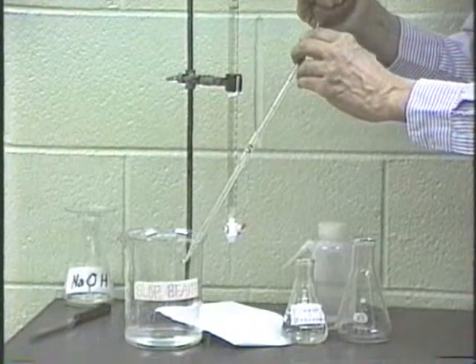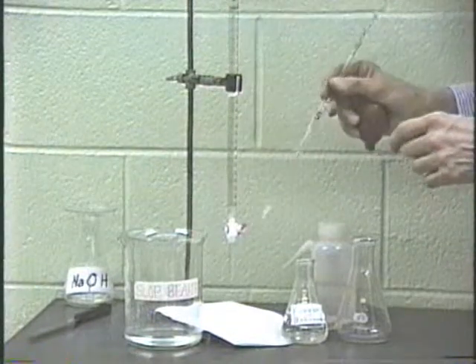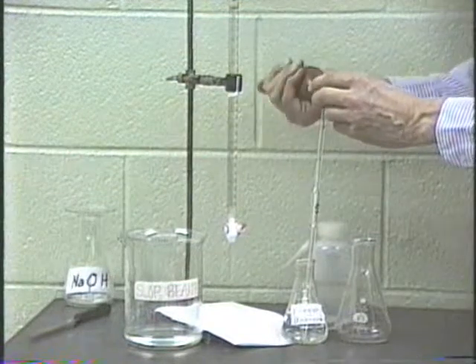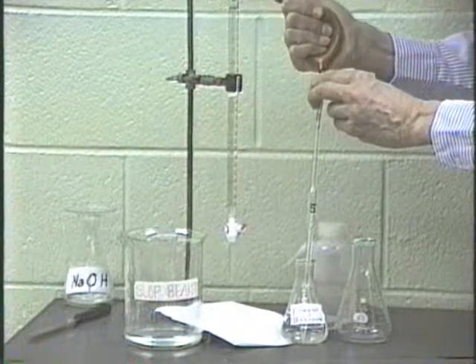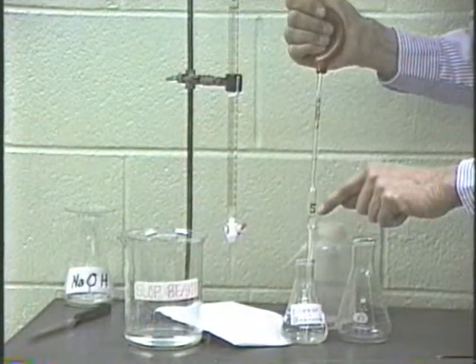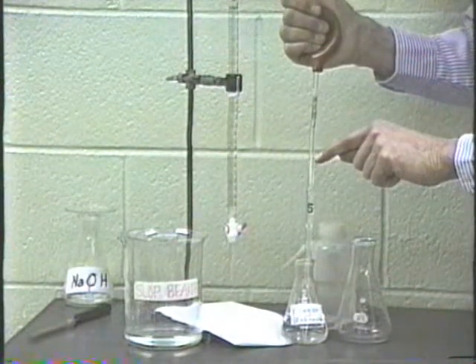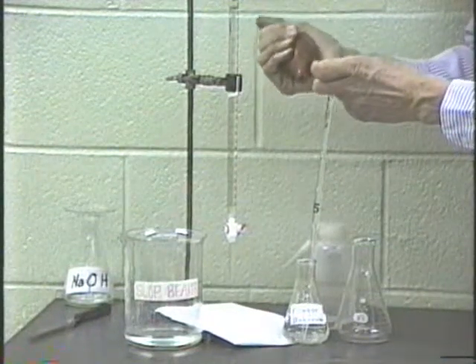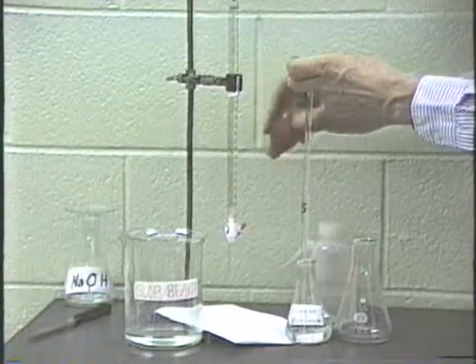We can use the rubber bulb to blow out at this point because we're not interested in exact volumes, we're just rinsing. Once it is rinsed out, then again, we will fill up the pipette. Now, to fill up the pipette, squeeze the bulb, just slip it on, and draw up the liquid. Here's the liquid level coming up here. This is the 5 milliliter mark, and now it's past that mark, bring it, but do not let it go into the rubber bulb. Whatever you do, do not let the liquid level go into the rubber bulb.